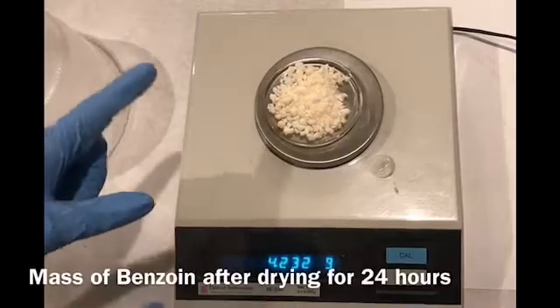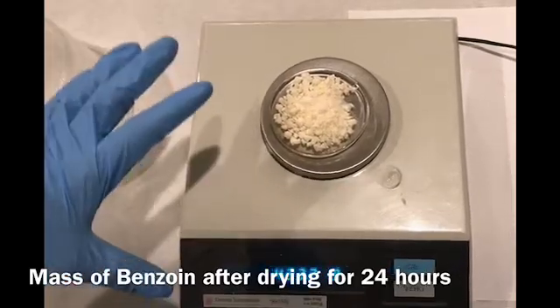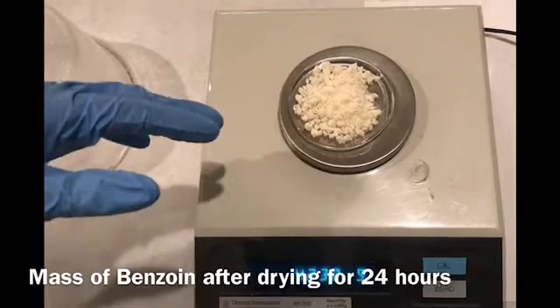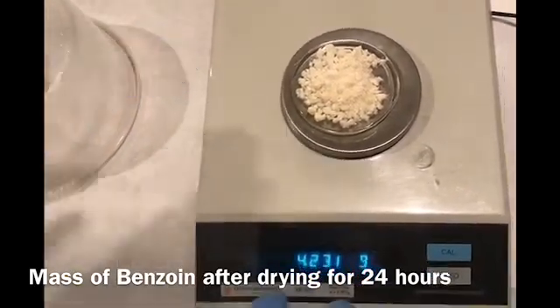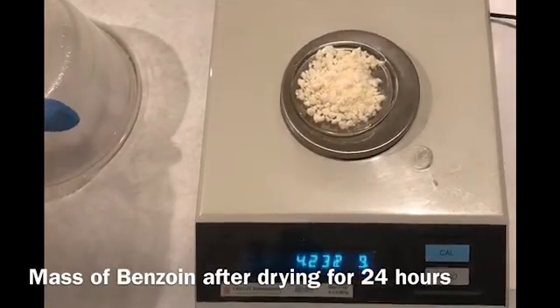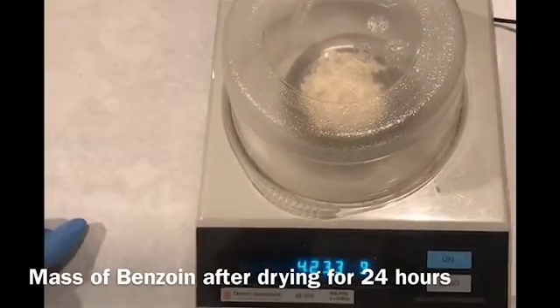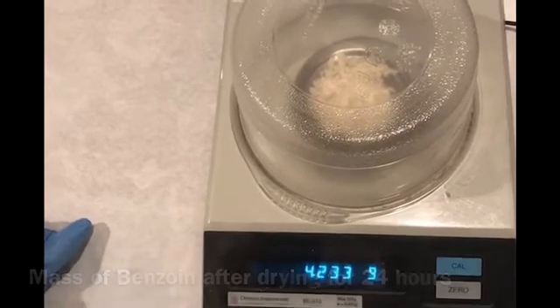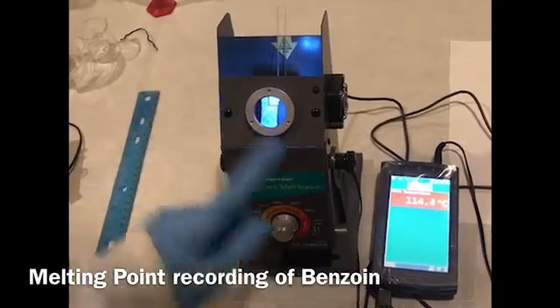Now I am transferring the filtered benzoin crystals to the watch glass. I let them sit overnight and these are the dried crystals of benzoin. Before recording the melting point, I will check the weight — that is 4.233 grams.